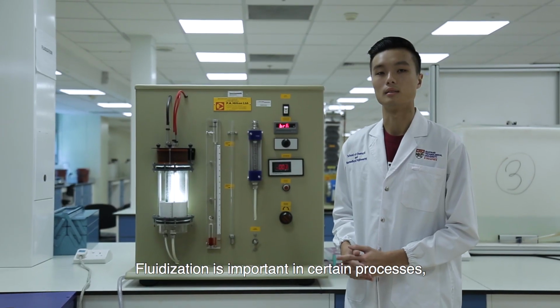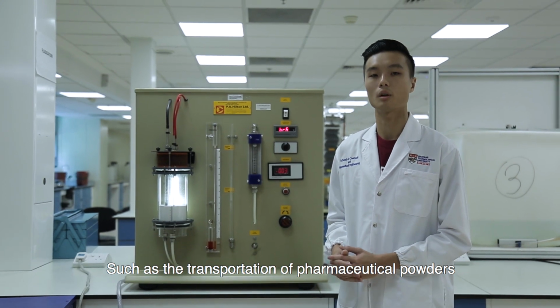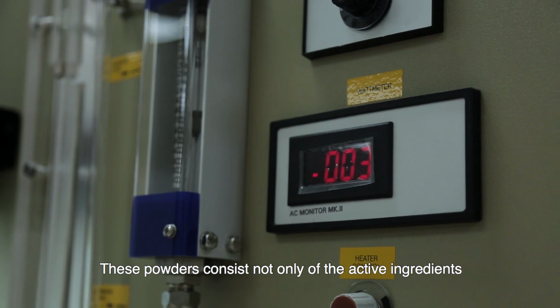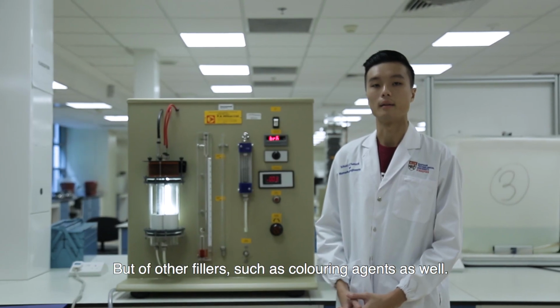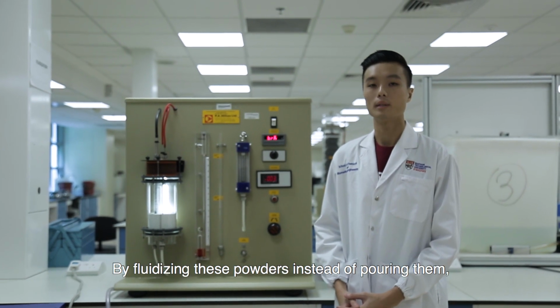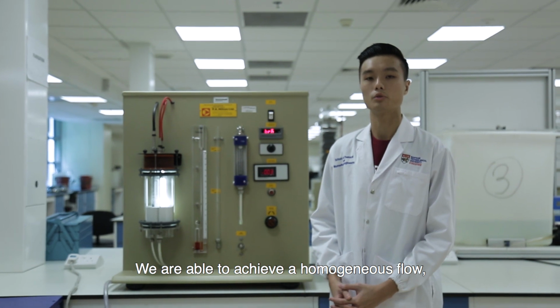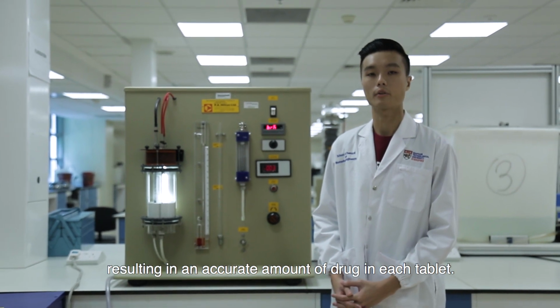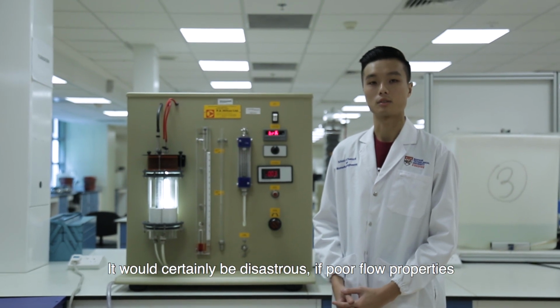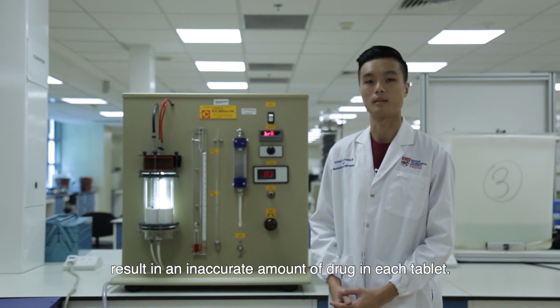Fluidization is important in certain processes, such as the transportation of pharmaceutical powders to be made into oral tablets. These powders consist not only of the active ingredient, but of other fillers such as coloring agents as well. By fluidizing these powders instead of pouring them, we are able to achieve a homogeneous flow, resulting in an accurate amount of drug in each tablet. It would certainly be disastrous if poor flow properties result in an inaccurate amount of drug in each tablet.